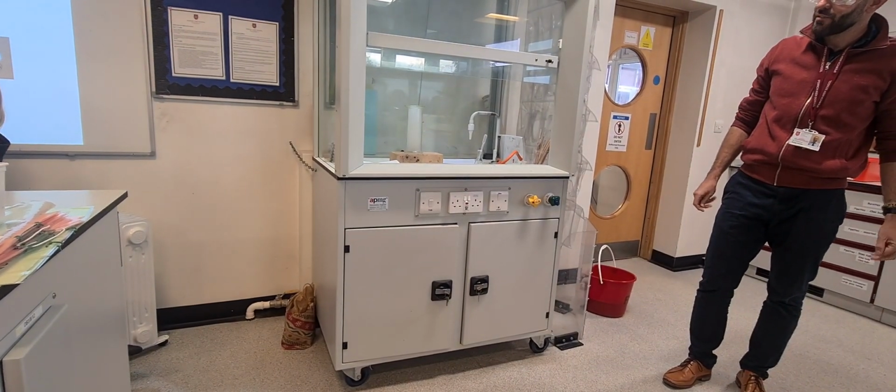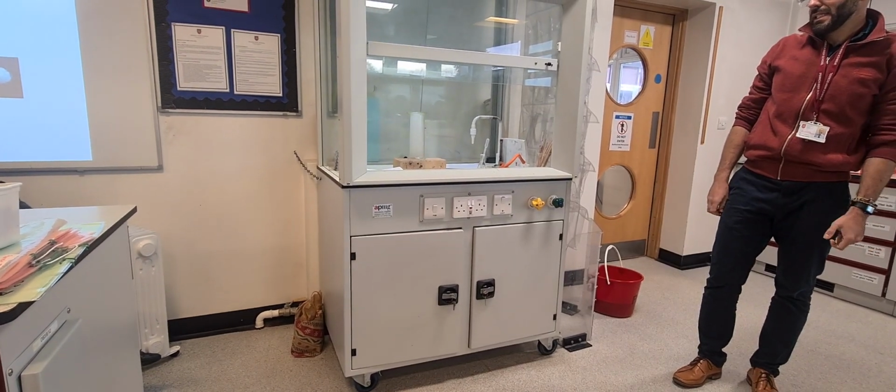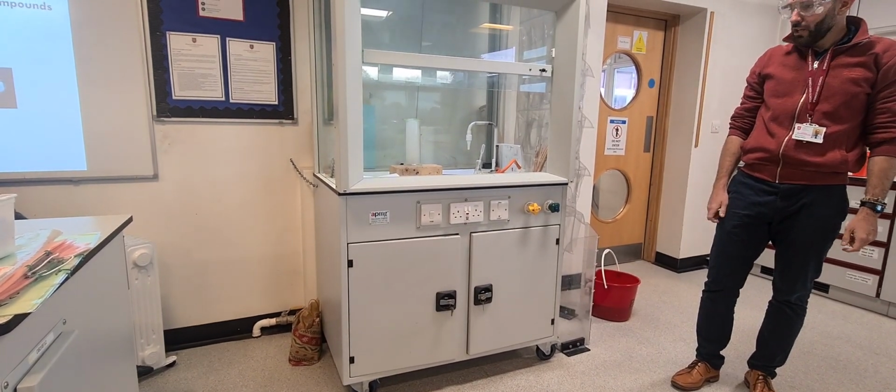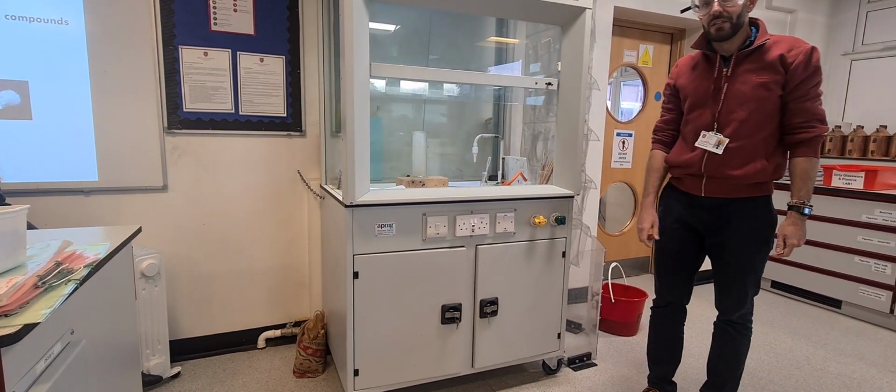You want to taste the salt after? We're not allowed. Oh, it's disappointing. Can I eat it outside the lab? We'll see how much we get.